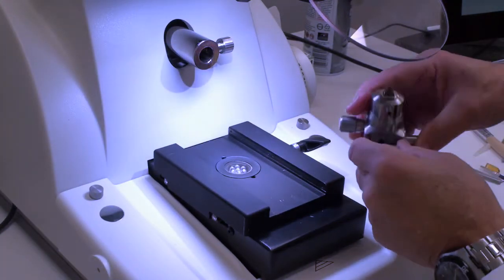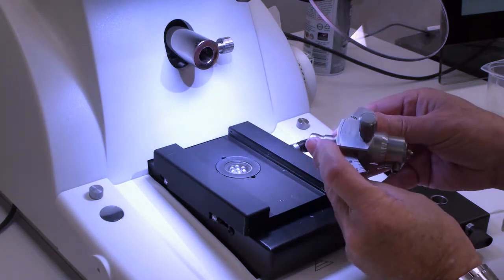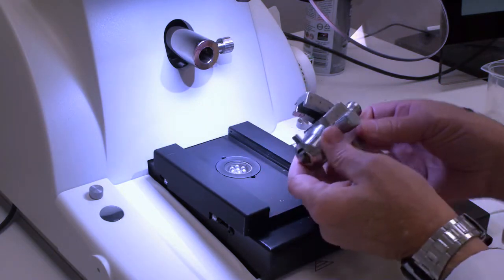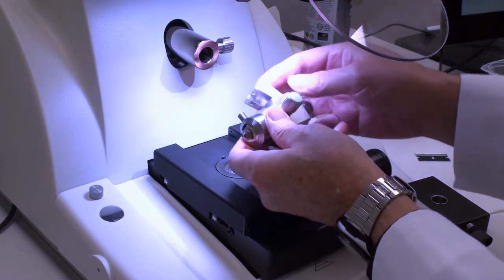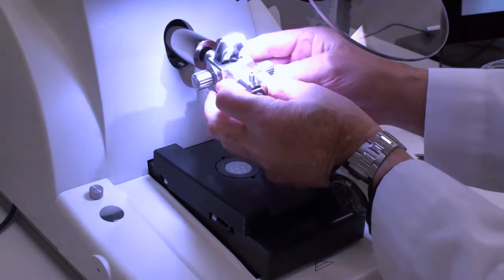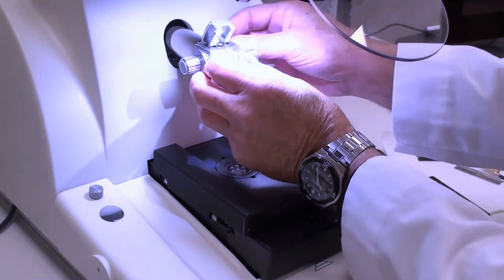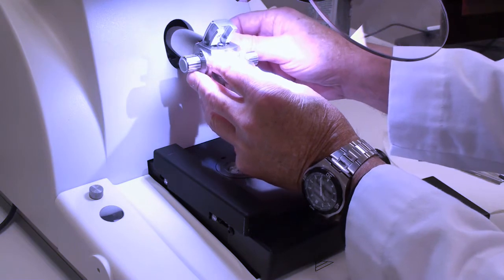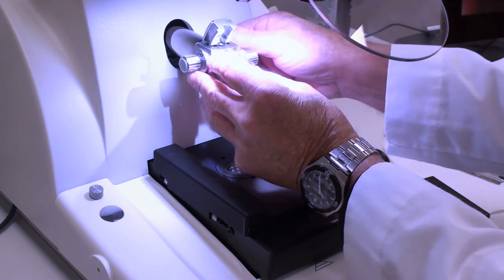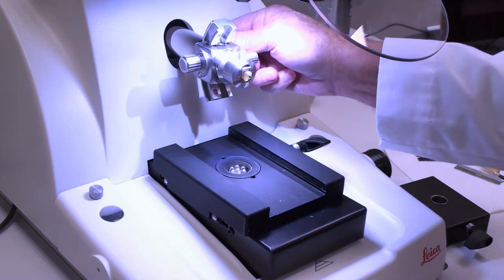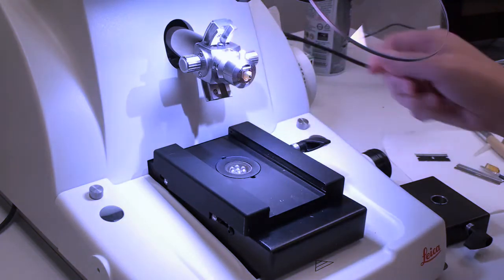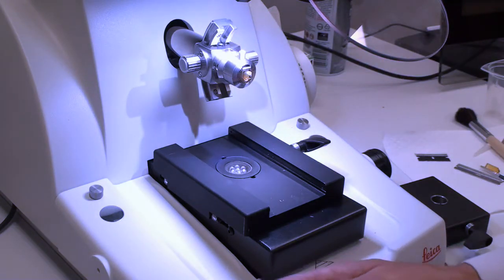Loading the sample chuck is important from a couple points of view. You want to make sure that the numbers are in the upper right-hand corner. That way, your specimen rotation and specimen arc will always be on the same side, so you don't always have to look and see which control you're moving. So you always want to be standard with these types of things.